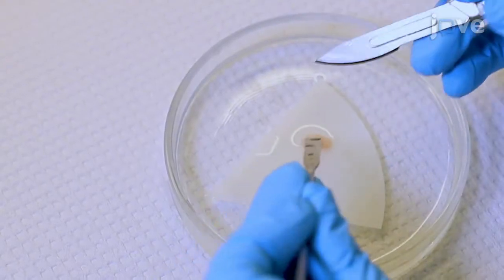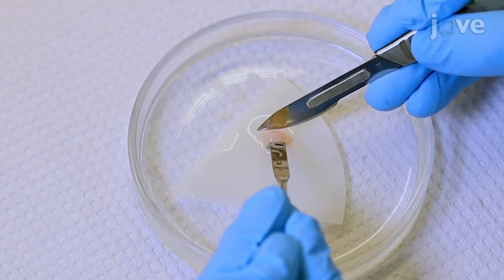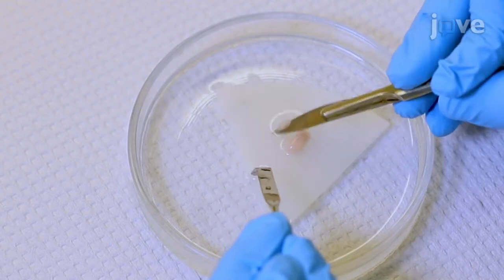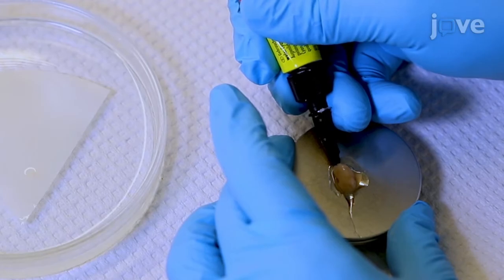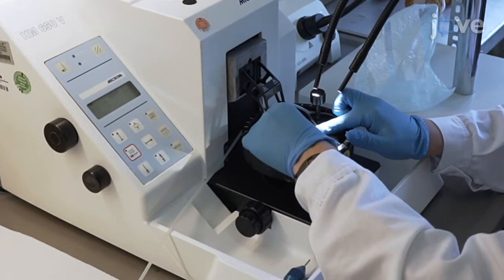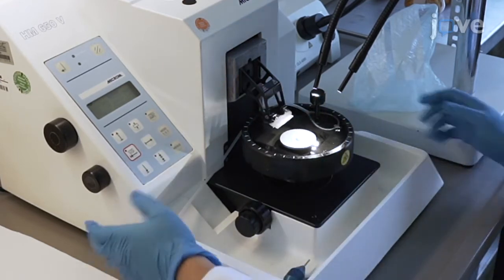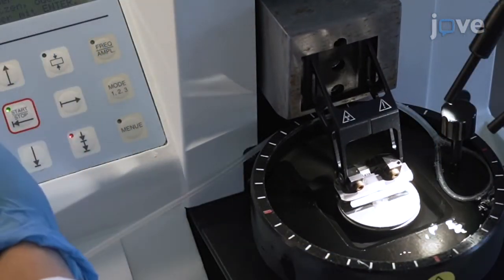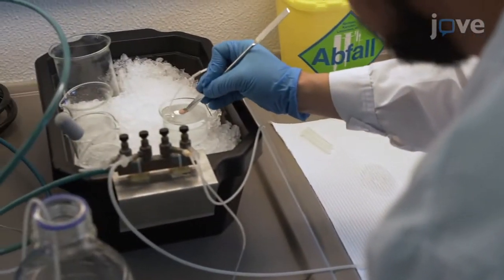In an ice-cold petri dish filled with ACSF, place the brain on a filter membrane. Separate the hemispheres and perform a parasagittal cut at an angle of 45 degrees. Fix one hemisphere at the vibratome tissue stage with superglue, and immediately transfer the tissue block to the vibratome bath containing ice-cold ACSF, bubbled with 5% carbon dioxide and 95% oxygen. Align the tissue in the vibratome bath. Keep the second hemisphere in ice-cold ACSF until slicing.